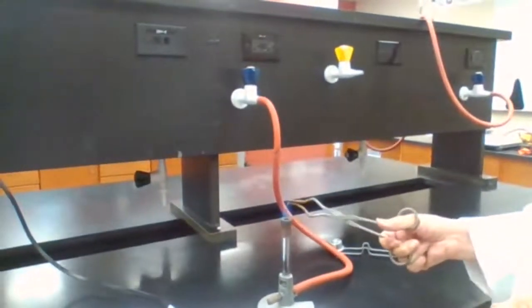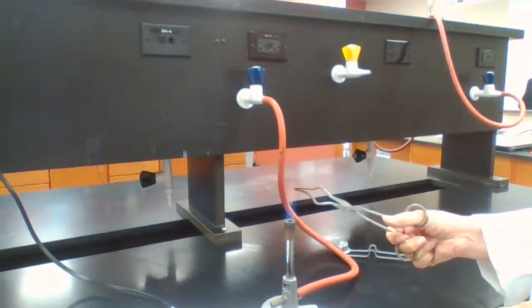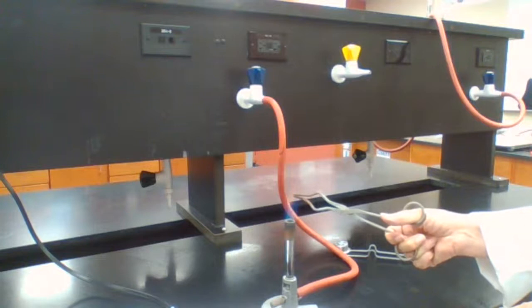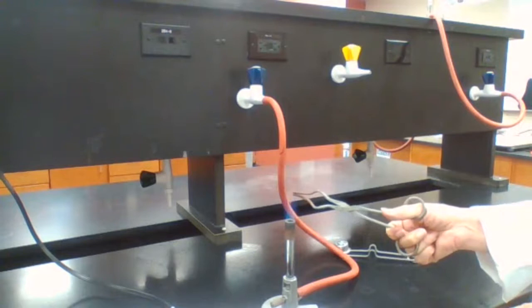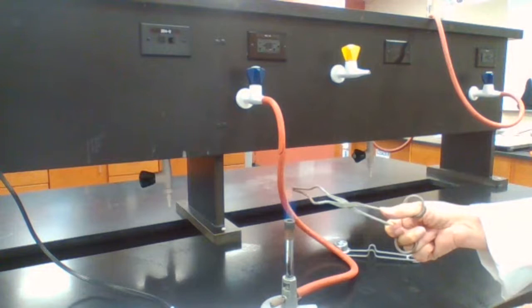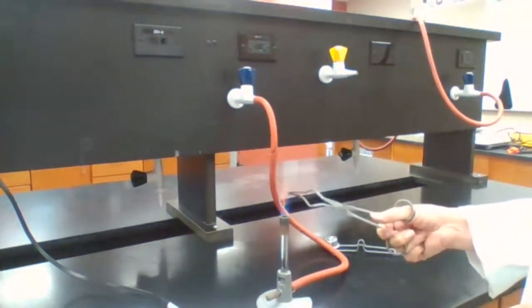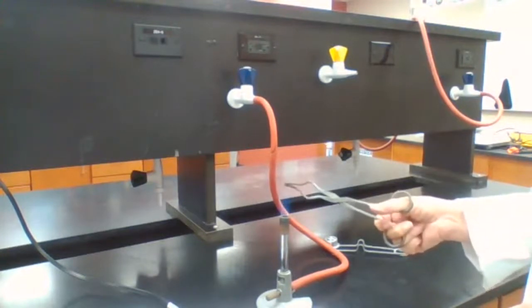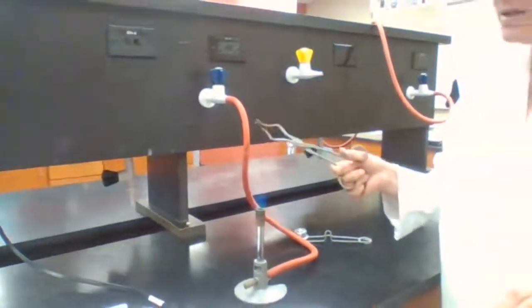If I bring a copper wire to the tip of the flame, note that the gas line has not been used for a long time, that's why we have such a weak flame here. You see the top of the inner cone changes the copper to red. It gives a red color, it's about to melt it. But down here is the cool flame, and up here is the hottest part of the flame. The temperature here, based on the combination of natural gas with oxygen, is about 1500 degrees Celsius, which is a very high temperature.